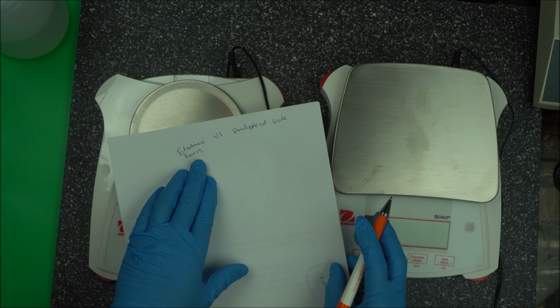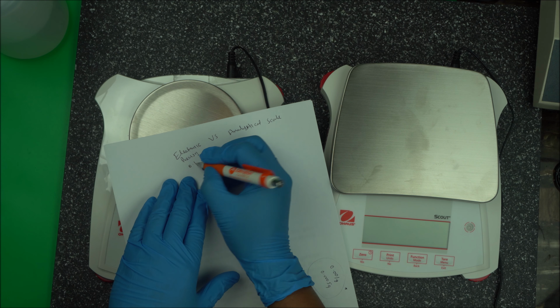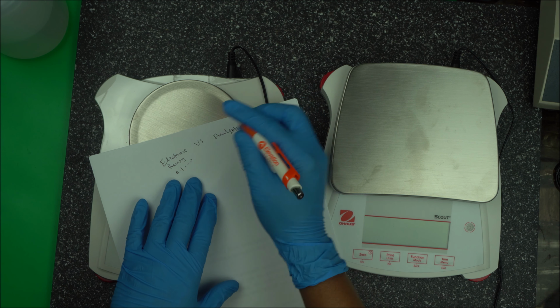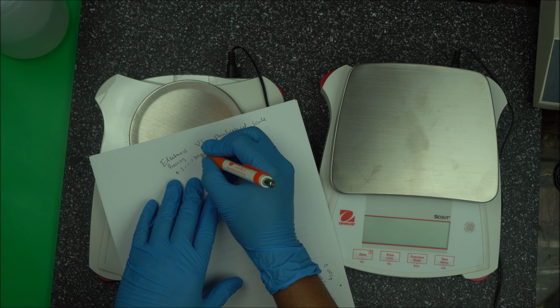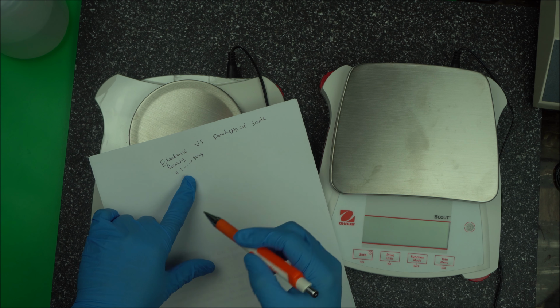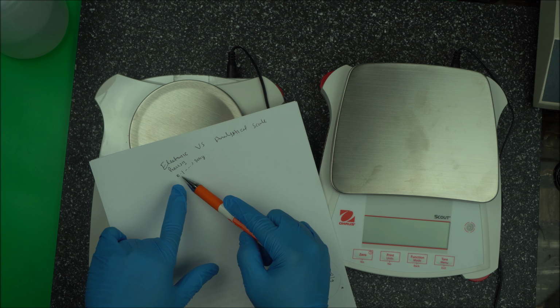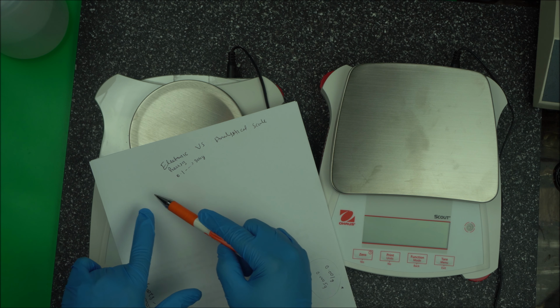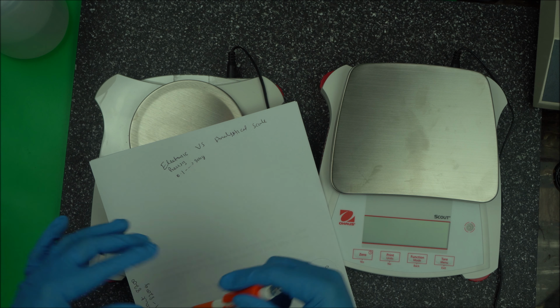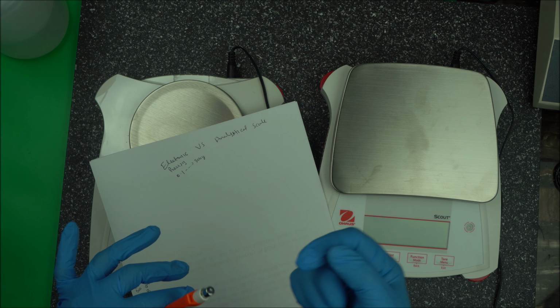Electronic precision scales most of the time start with 0.1 and can go all the way to sometimes 30 kg, if you are working with a good brand. But the lower this amount is, the more expensive your scale is. Analytical scales are the scales you use to measure tiny amounts of ingredients.